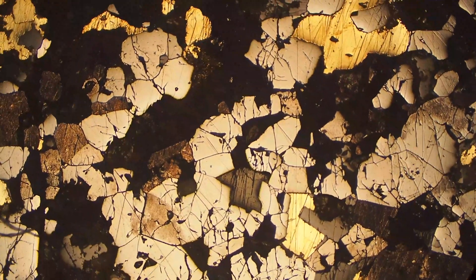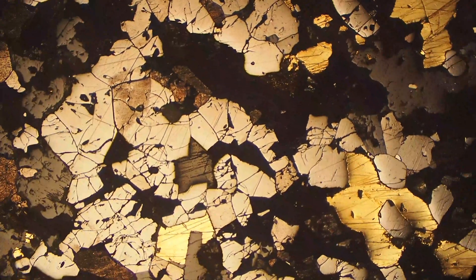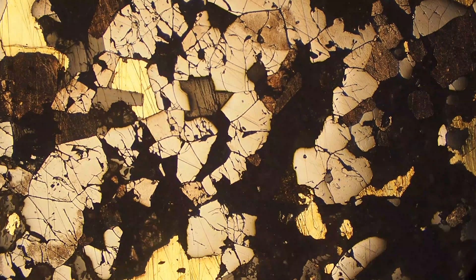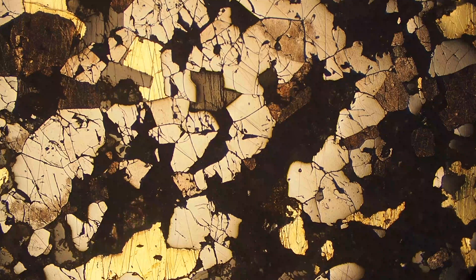You can see again with the chalcopyrite it's much higher in relief. One other thing with magnetite is that it can commonly have exsolution of hematite, or sometimes ilmenite — not the case in our samples today, but those are things you may see in the future.